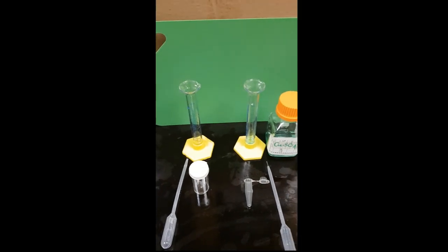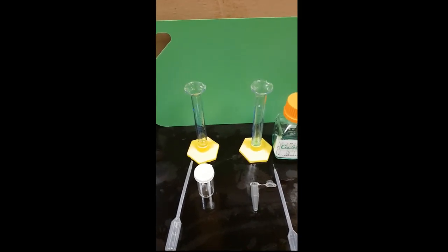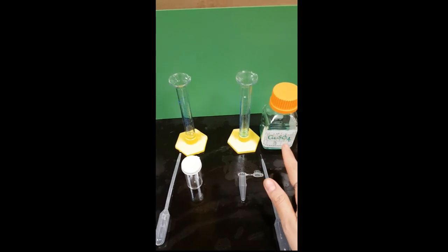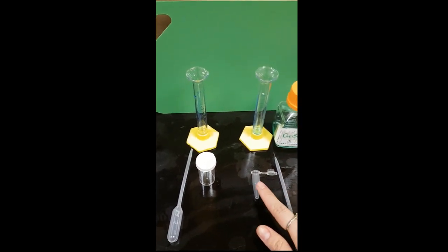In this lab, we're trying to figure out the mass relationship before and after a reaction has happened. We have copper sulfate as one of the reactants.